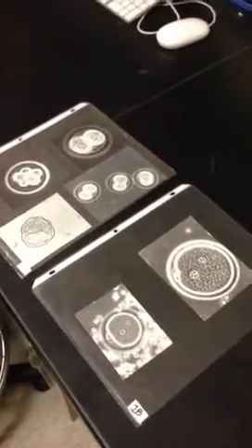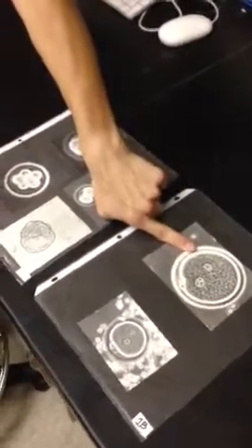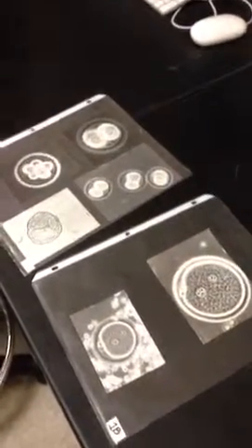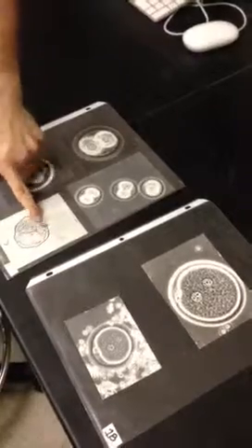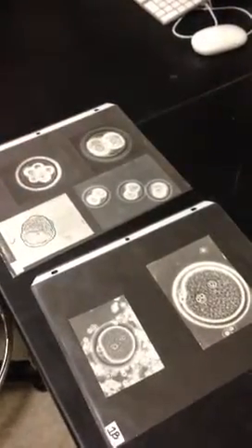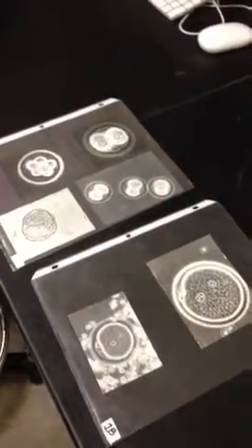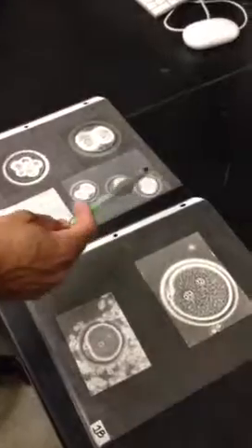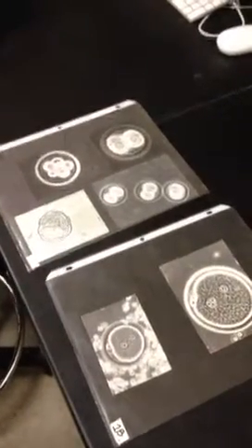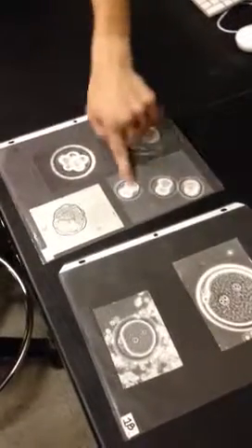Okay. So you've got two half nuclei here, right? So that should definitely be first. That one's last, because this has the most cells. It's got so many cells that it's zoomed out so that you just see little dots of the cells. And so now you've got the middle parts. This should be second, because it's got two individual cells in there.